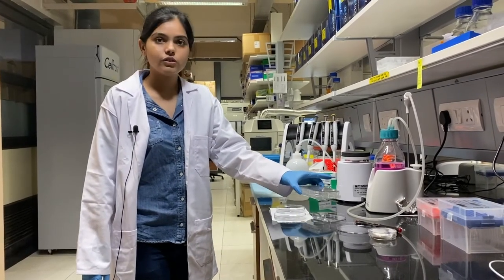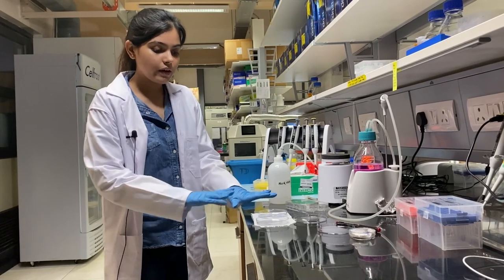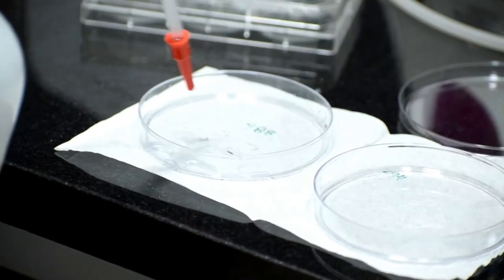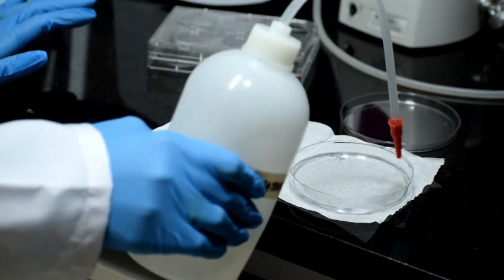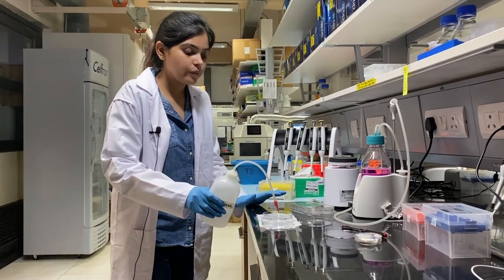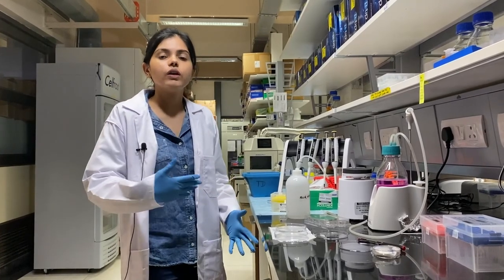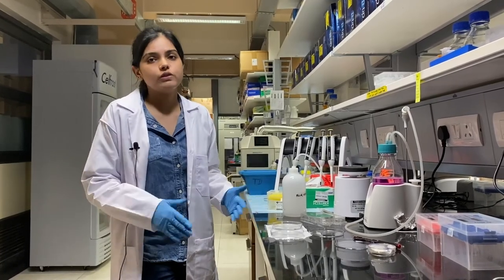After one hour in the oven, I have taken the gels out and placed them on petri dishes — you can already see they have expanded a little. Now we do the final step: adding water. We do three rounds of expansion — 30 minutes, 30 minutes, and then an overnight expansion. By the end, the gel will have expanded to five times its original size.